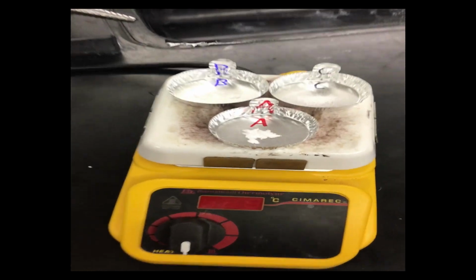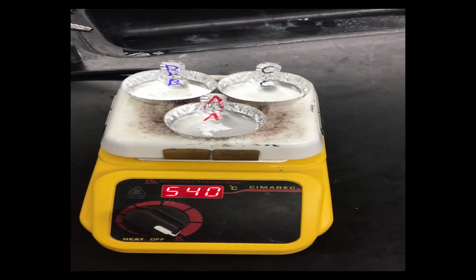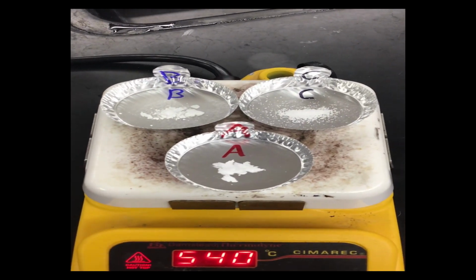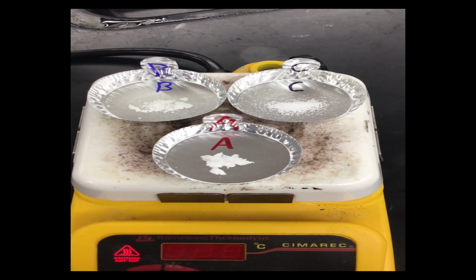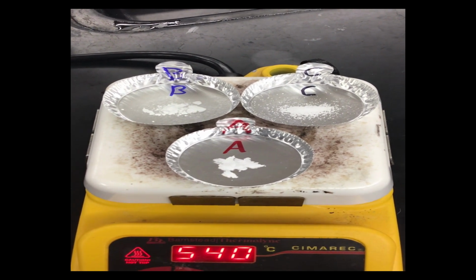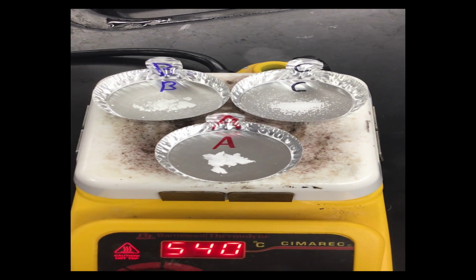The second test that we do is a melting point test. So I've already preloaded up substance A, substance B, and substance C onto our hot plate, and I'm going to turn this on full power, and then we're just going to watch and see which ones melt and which ones do not, okay? Going back to our lab, we know that the lab tells us that once two have melted, we should stop because the third one will not melt in any usable time.